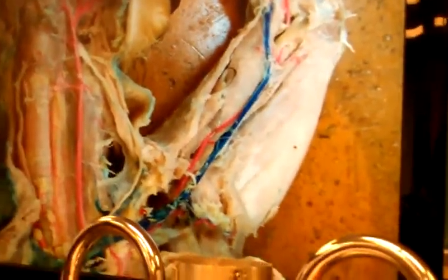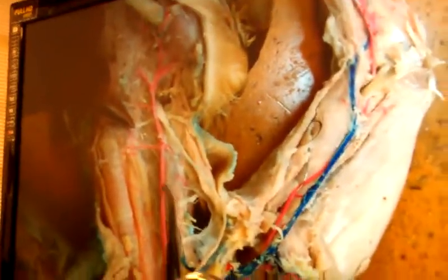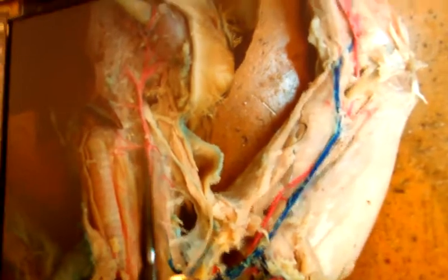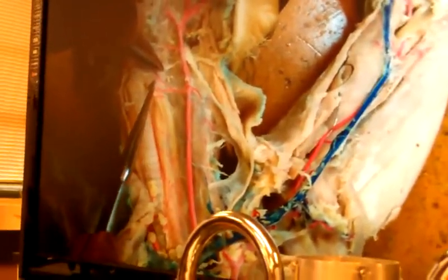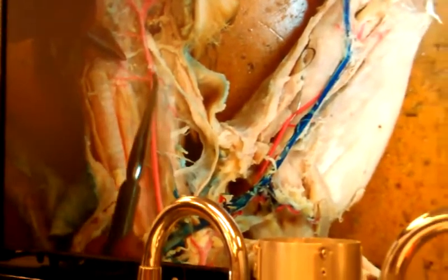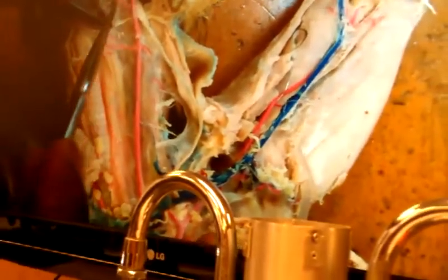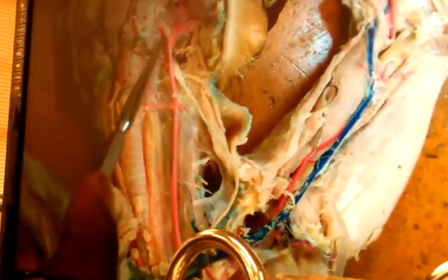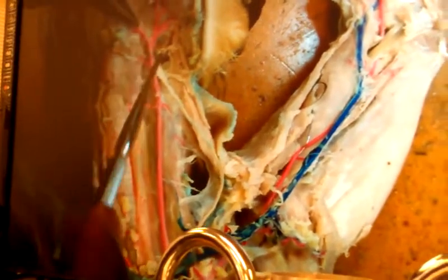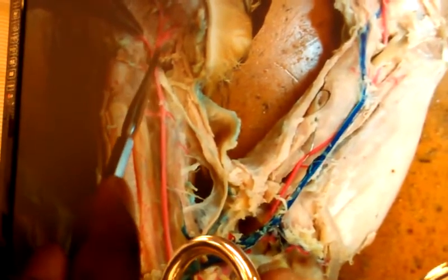So, Mr. Gilmore, do those in order so I can participate. I got this structure right here coming up. What's his name? Left common carotid. The first vessel comes off toward the thyroid, so we're going to call him superior thyroid. If that's superior thyroid, opposite of him is muscularis. Keep going up. And I notice there's a structure that goes toward the larynx, so we're going to call him laryngeal. If that's laryngeal, keep going up. And there's one going toward the tongue, and that's lingual. Watch this right here. After lingual, Mr. Gilmore, I'm going to change my name from left common carotid to who?